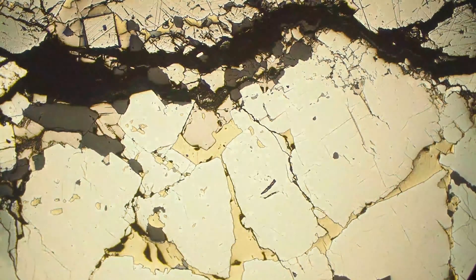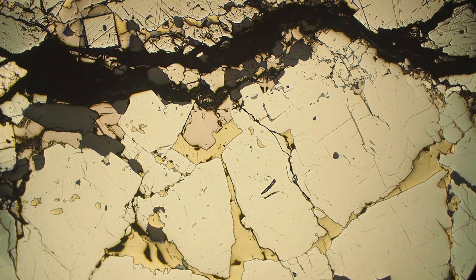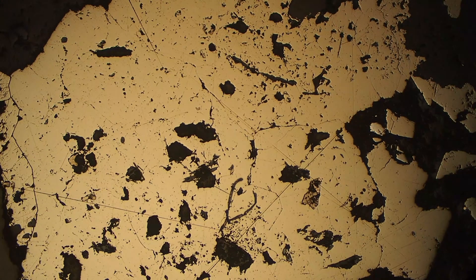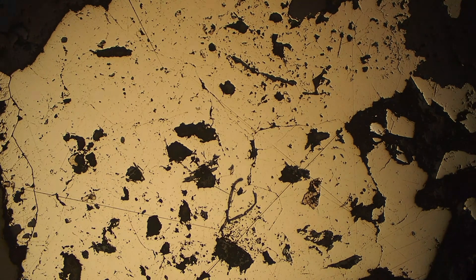One other thing to pay attention to is what we call relief. You can see when we put it back into regular plane polarized light that the pyrite seems to sit above the chalcopyrite, and that's because pyrite is quite a bit harder so it's more resistant in the polishing.